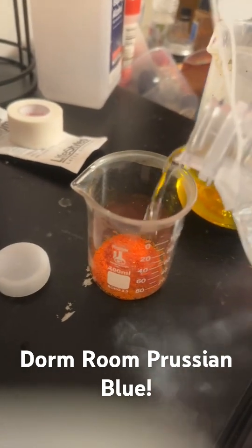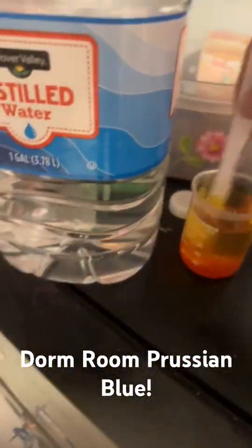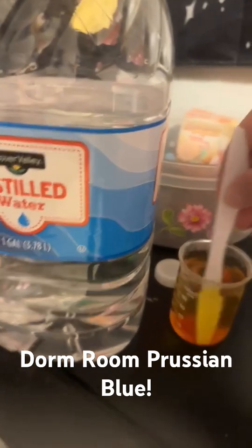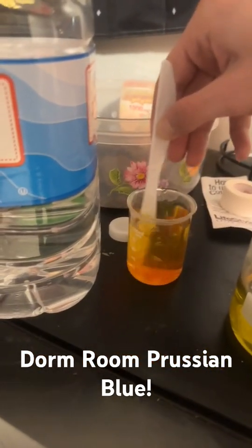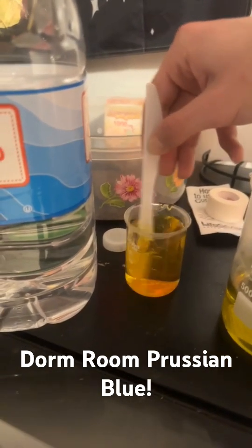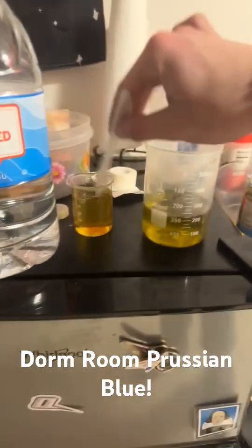just gotta add this, give it a little stir. Oh, I need to get a plastic knife. All right? Stir that up. Make sure it's nice and dissolved. Probably gonna have to add more, but you know, it's all right. That's a pretty solid amount dissolved.